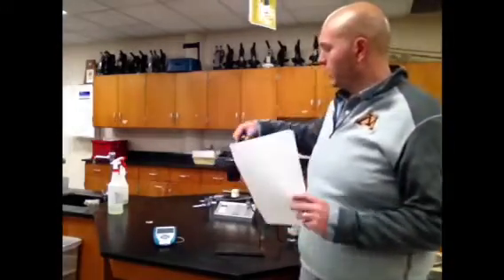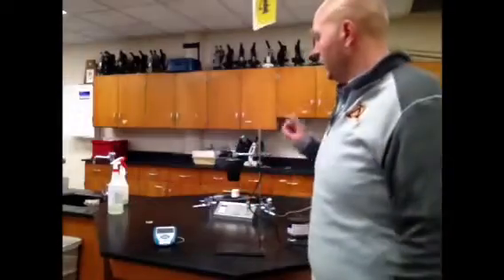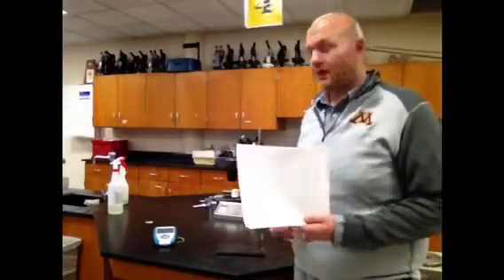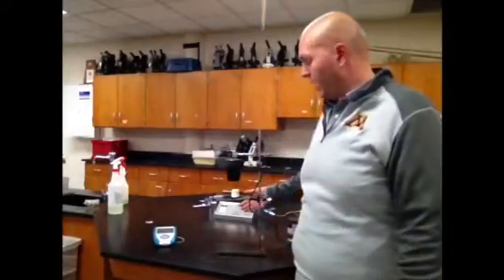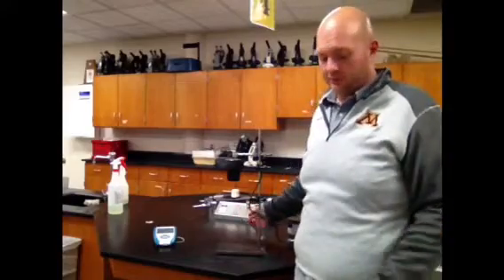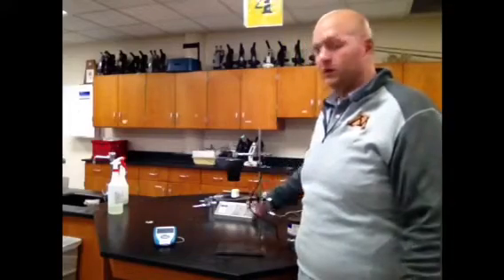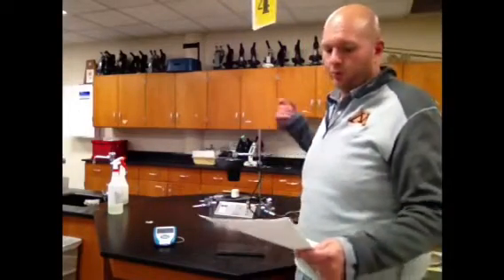Dependent, or responding, variable is what we actually are measuring. In this case, it's temperature, and we're going to use that temperature to try to find energy. So you can put either one of those down because they're roughly the same thing for this one, but our dependent variable happens to be temperature. Controlled things: hopefully we'll be able to use the same amount of water both times. Hopefully we'll keep the same distance, the same temperature in this classroom. Hopefully we'll have one match, so we can keep that consistent. All of the regular things that you normally have as your controlled variables are still your controlled variables: distance, water, temperature, the normal ones you've put down.